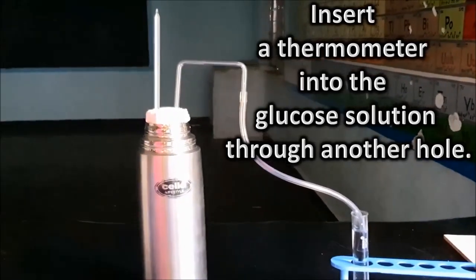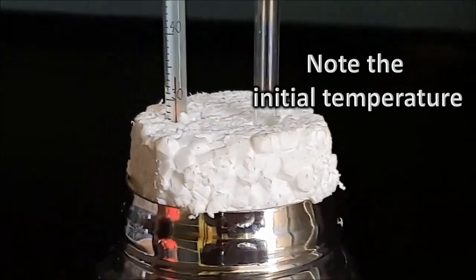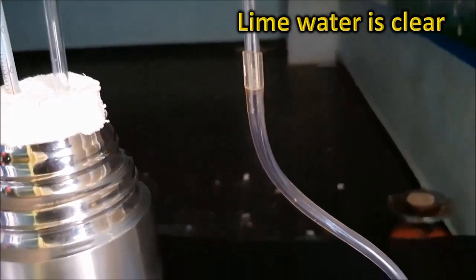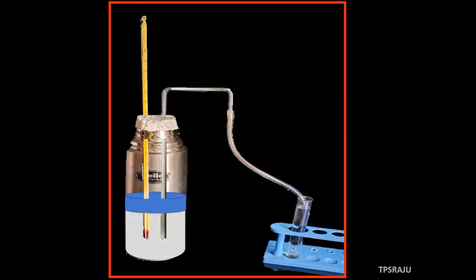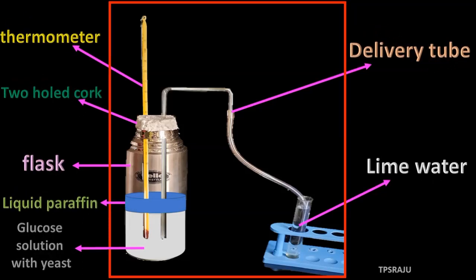Record the initial temperature of the thermometer. Observe carefully, note the initial temperature. It was around 33.5 degrees Celsius. You can see lime water is clear. So before the experiment, the initial temperature is 33.5 and the lime water is clear. You can see the entire setup. You can observe the thermometer, two-hole cork, flask, liquid paraffin, glucose solution with yeast, delivery tube, lime water.